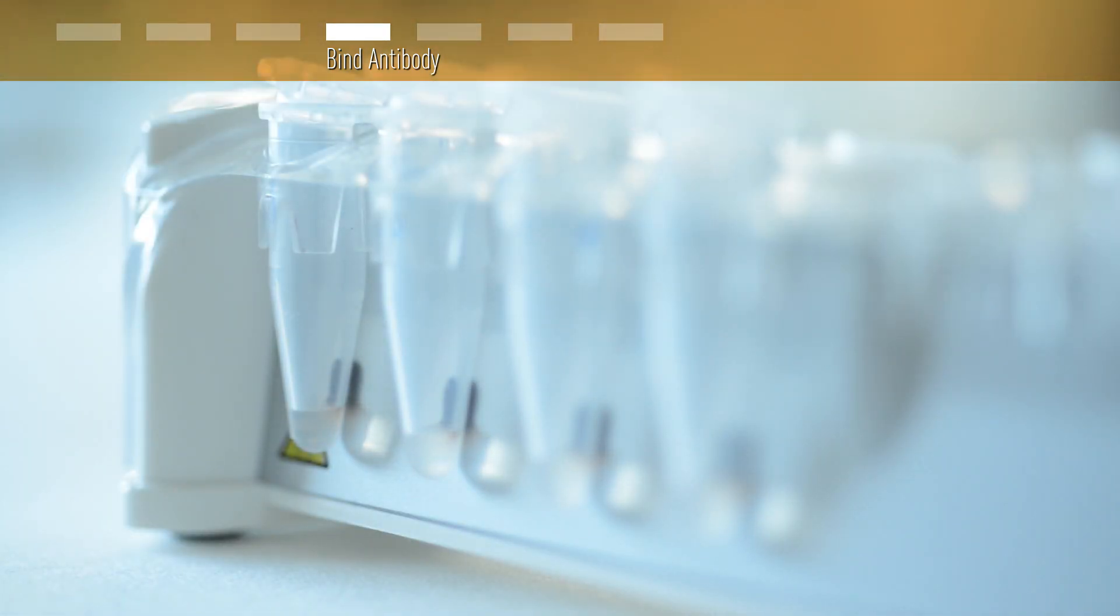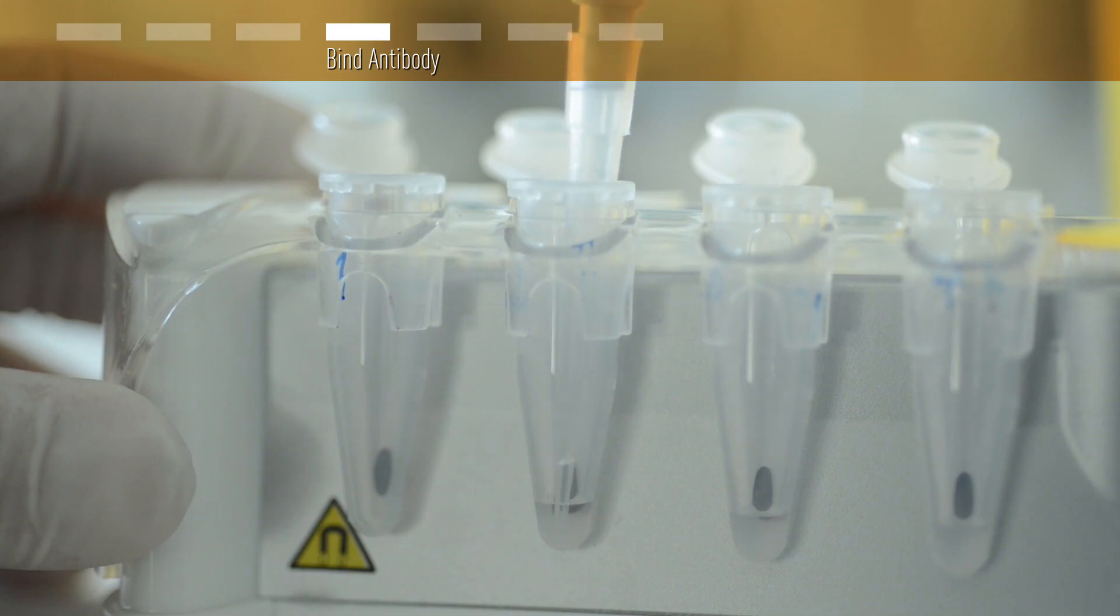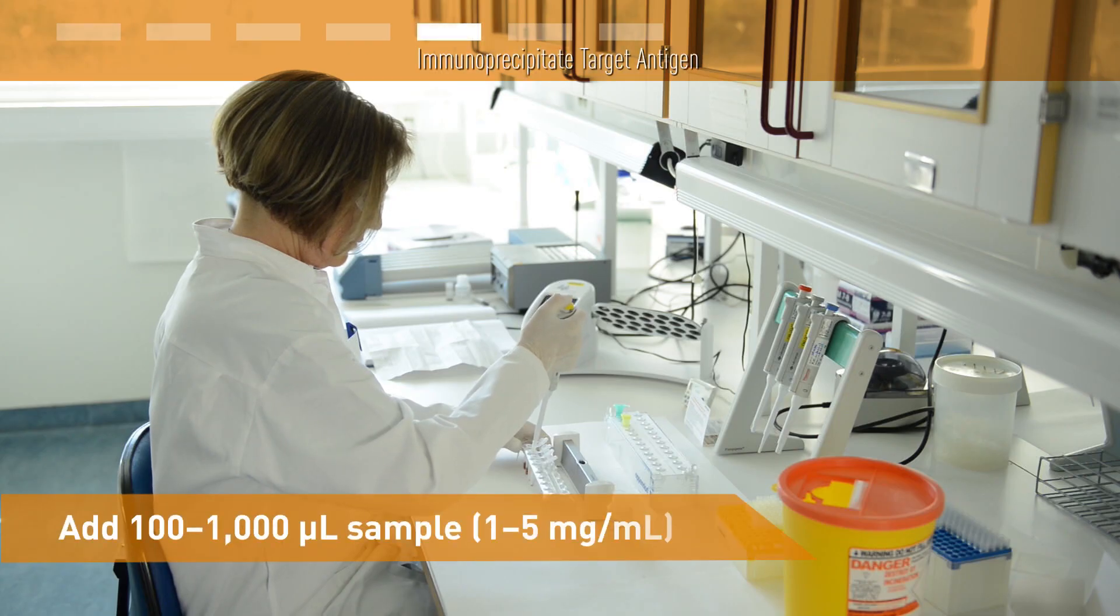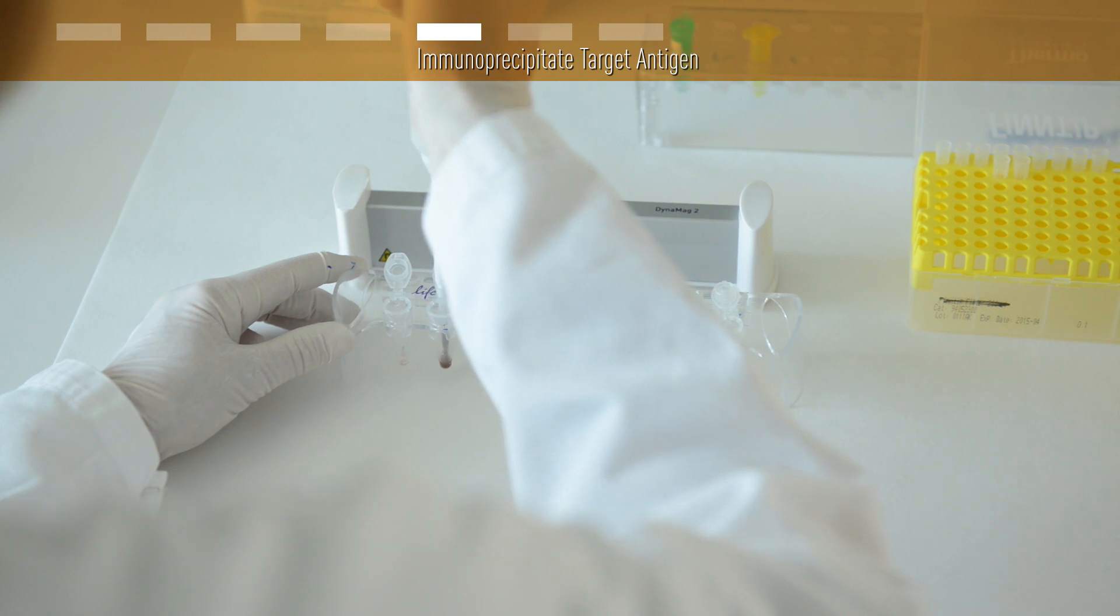The beads are pulled to the side of the tube. Make sure you don't lose any liquid hiding in the cap. Now add your sample to the beads and pipette gently to re-suspend. The rapid kinetics allows for a short incubation.